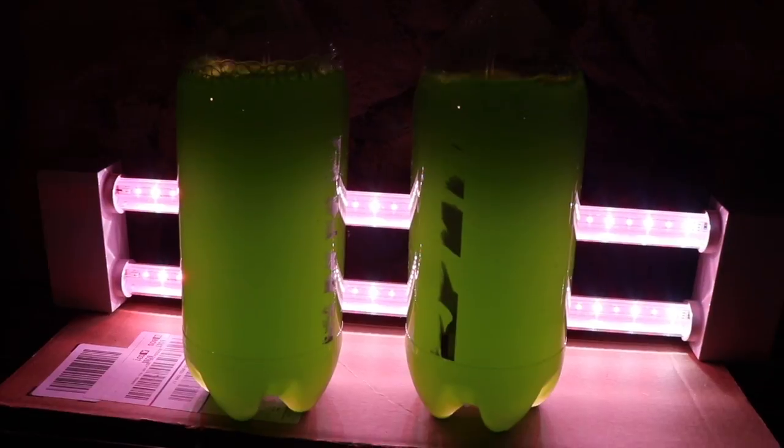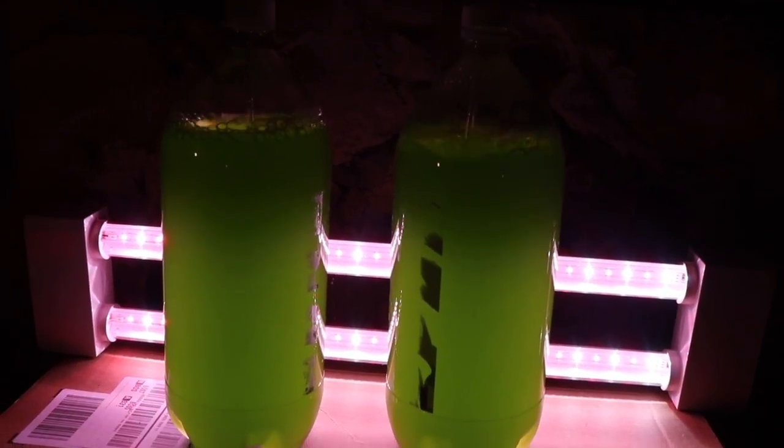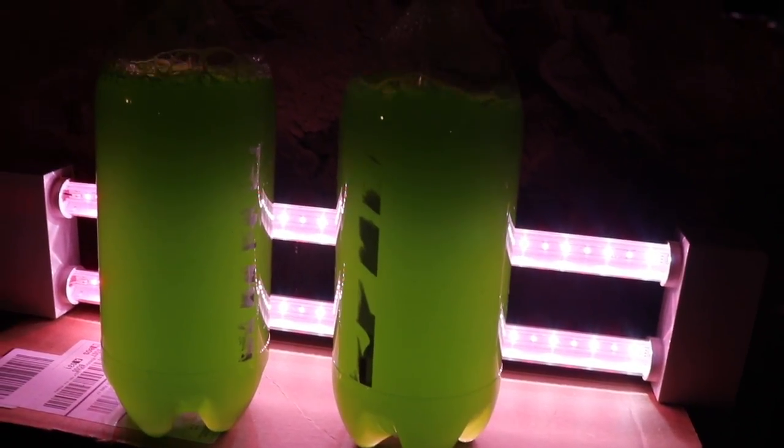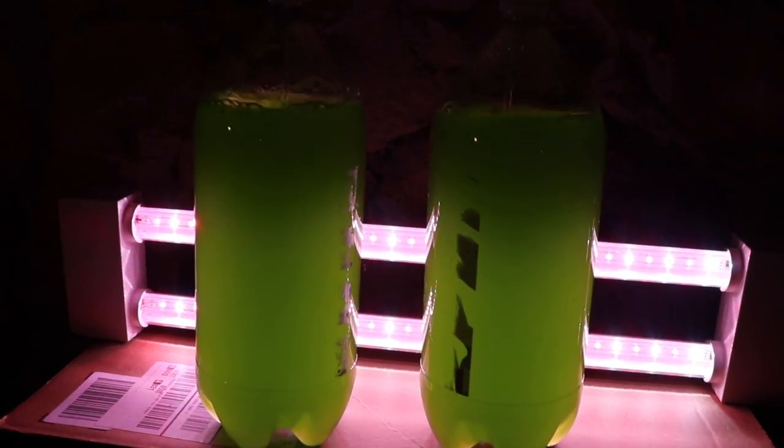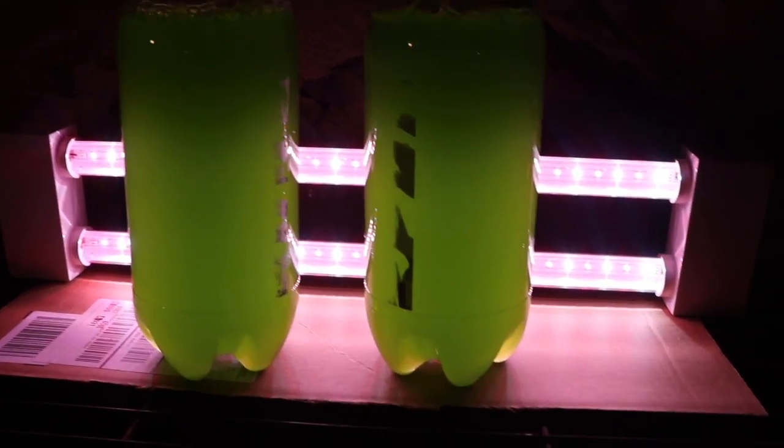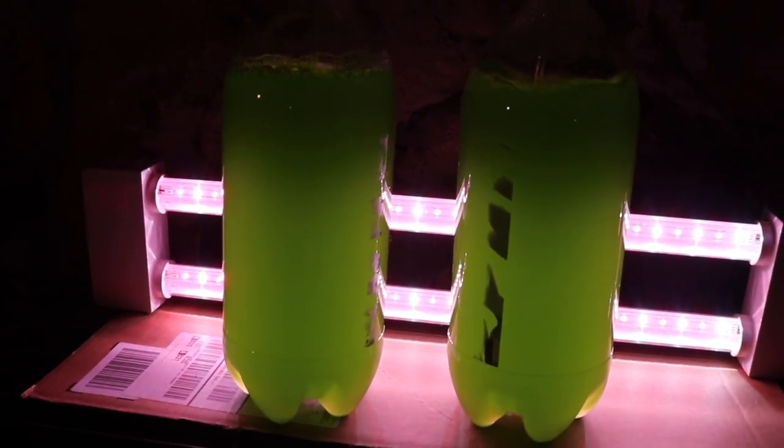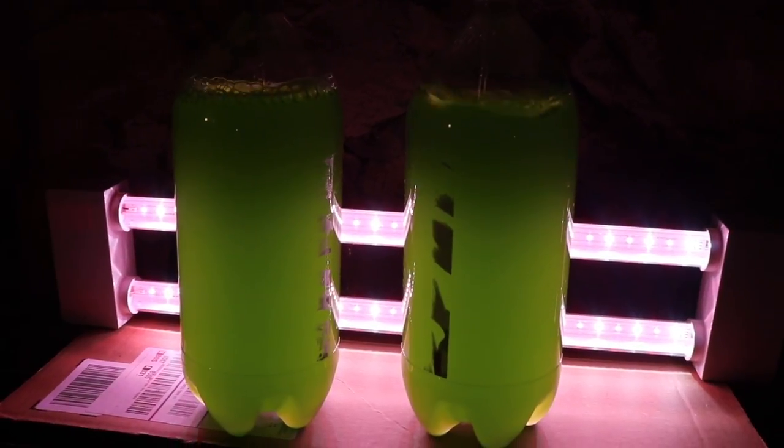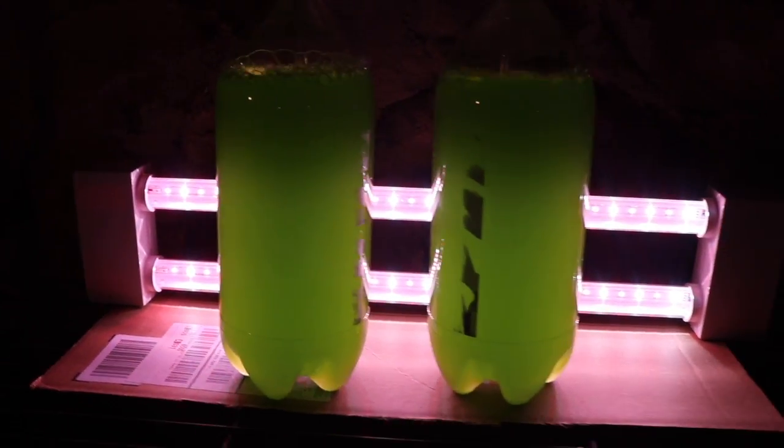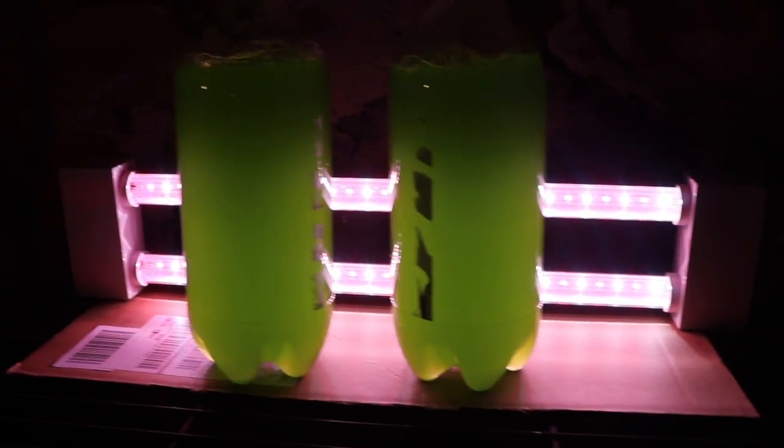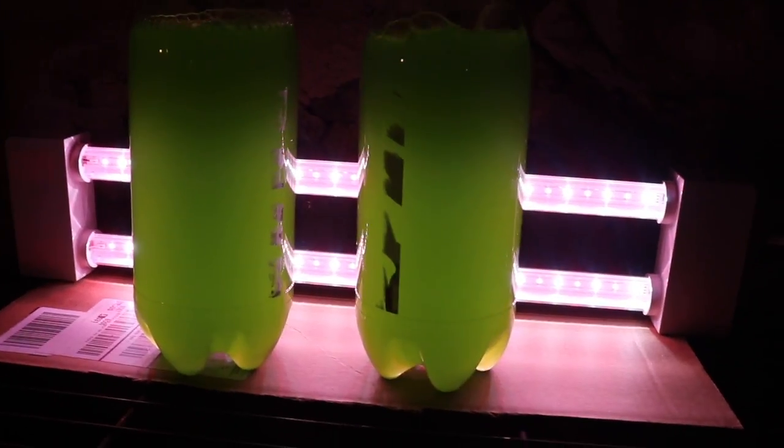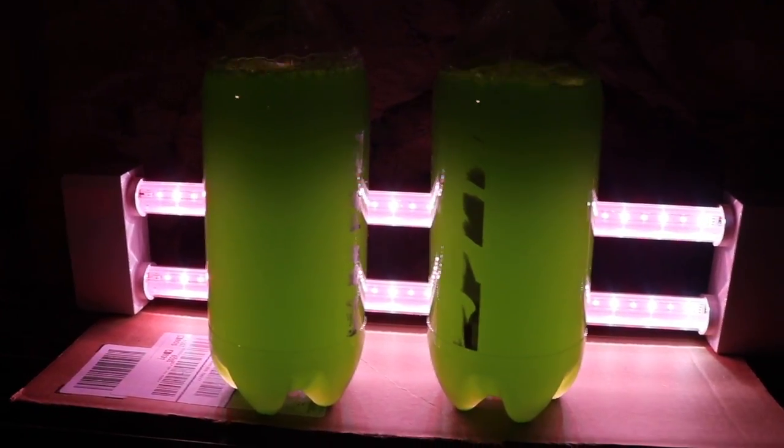Alright guys, so here is the phytoplankton all set up. We got the bubbles going to it, and I forgot to mention that a valve is pretty important for controlling the airflow going to the phytoplankton. You want that to have like a slow boil going on—you definitely don't want to pound that with a bunch of air. But pretty happy with the light. We're going to let this chill for about seven to ten days, and then we're going to go ahead and split it, get some more two-liter bottles. Hopefully I can get some rubbing alcohol so I can properly sterilize some stuff. But this is it guys—this is all you need to culture phytoplankton and start getting into aquaculture. We'll keep you guys posted on any updates and see how this culture turns out.